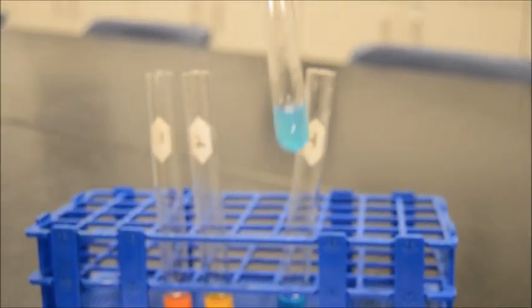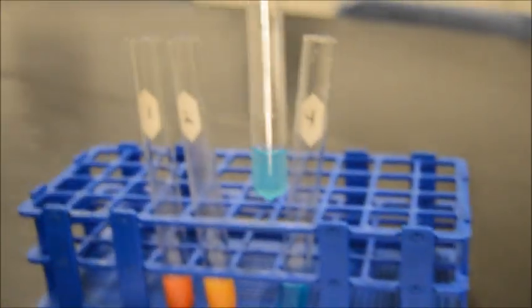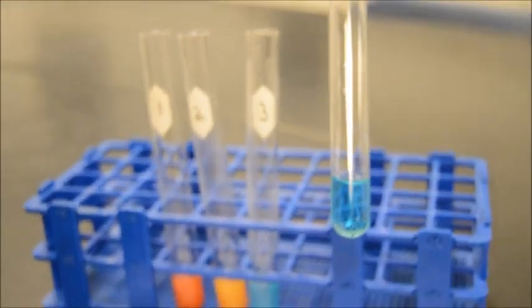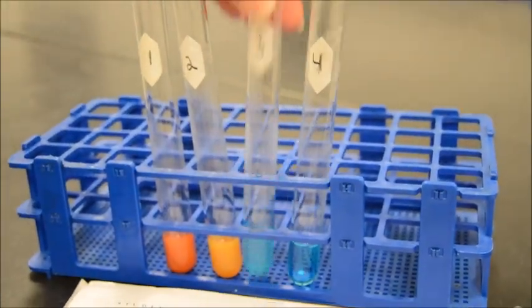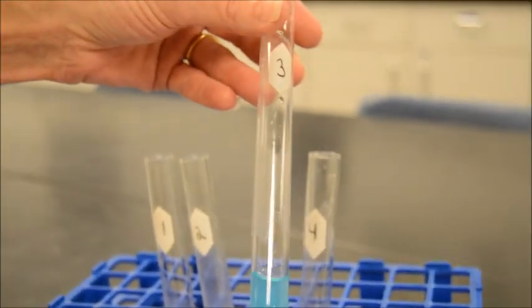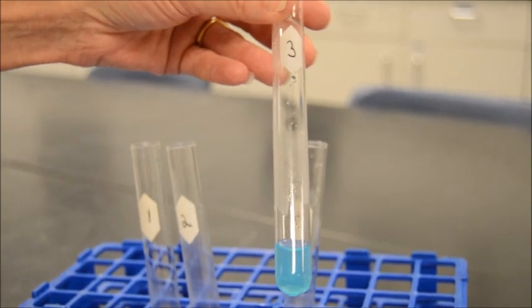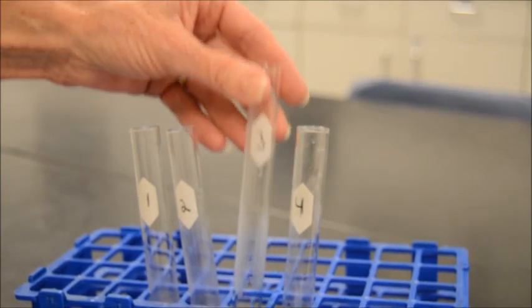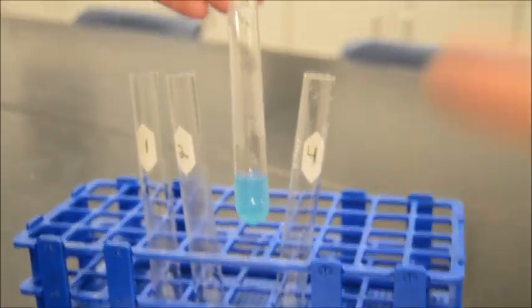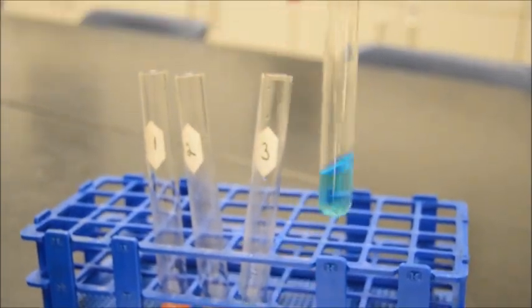And then our last 2? Okay, number 3 is, let's pull this out, starch, sorry. Starch. And then we have distilled water. Now starch being a polysaccharide obviously did not have any kind of color change. All right. And even though starch is made of simple sugars, they are not free simple sugars. And that's the idea. This test is for free simple sugars, in other words, unattached. So they are simple bound sugars, in other words. You could take that and you could treat it with an enzyme which breaks down starch, and it would then change colors, which is fascinating.